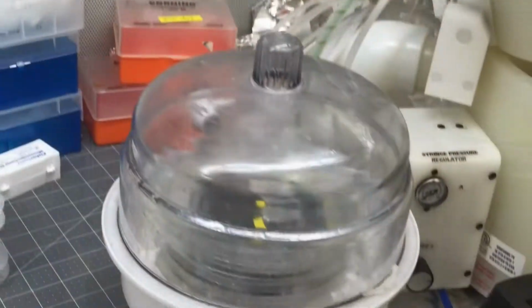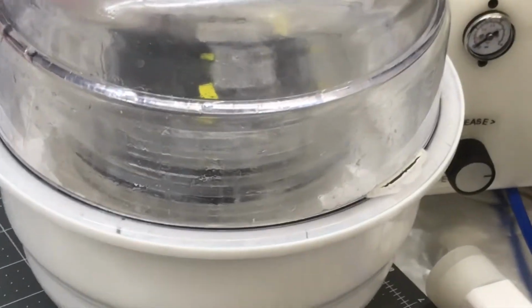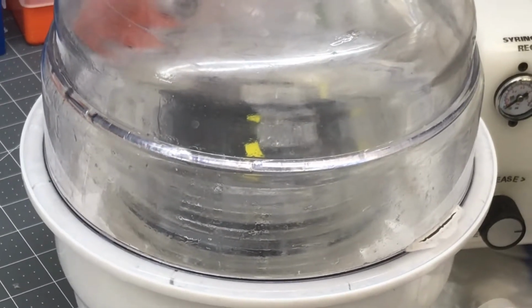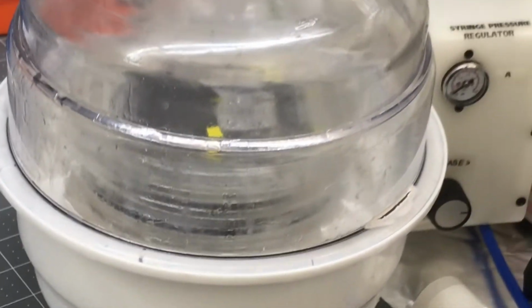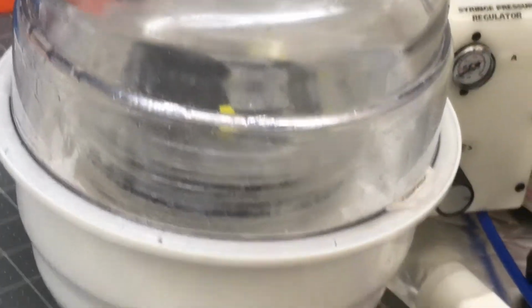Good. So easy. Yeah, I see all the steps. Although when you add the PDMS, with the naked eye you do not see any bubbles. But when you put it in the vacuum, then you see that there are bubbles. Without doing this, if you put it directly in the oven, you cannot work with your chip.